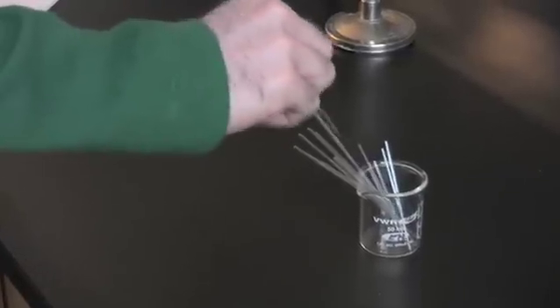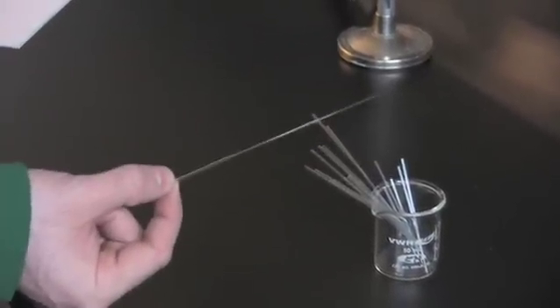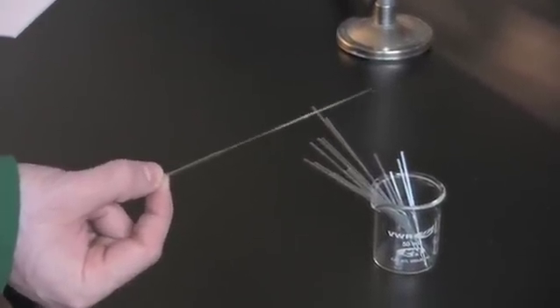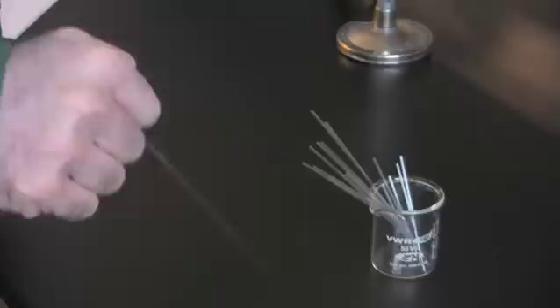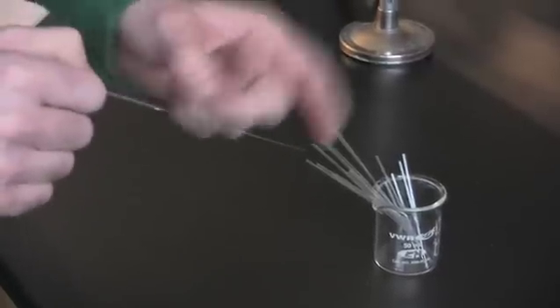Now the problem is that for these tubes, the long ones, this is very delicate. And so if you go to take up your sample and then spot it on a plate, this part's going to snap off.